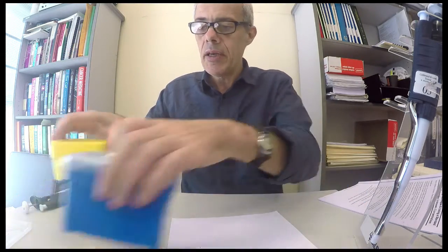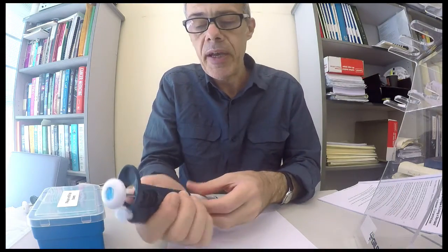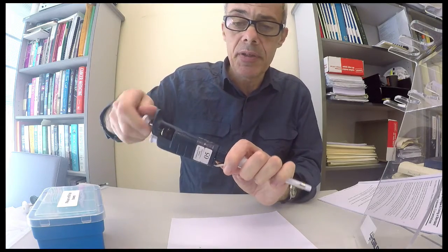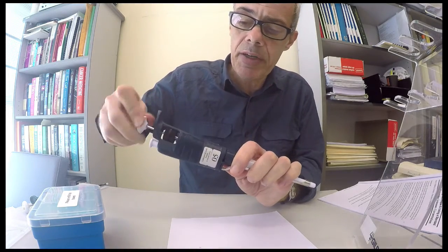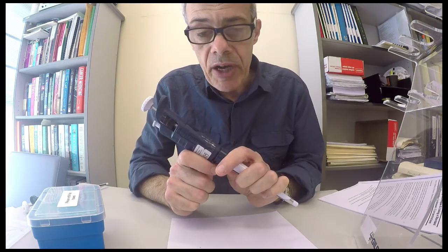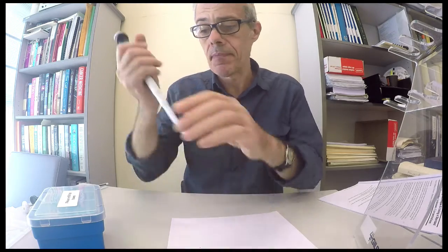Let's just quickly repeat that procedure with the P1000. Say I want to pipette something greater than 180 microliters, because I would use the P200 for 180. Let's assume 500 microliters, half a milliliter.